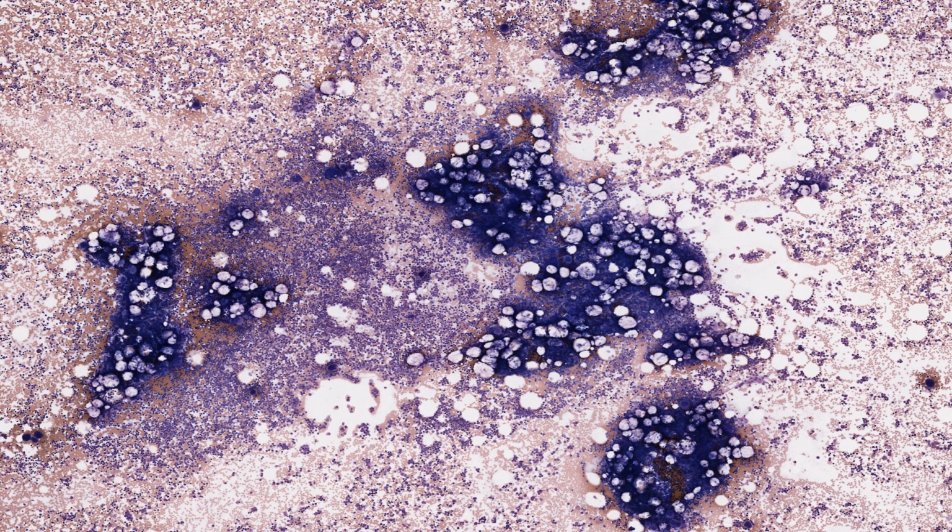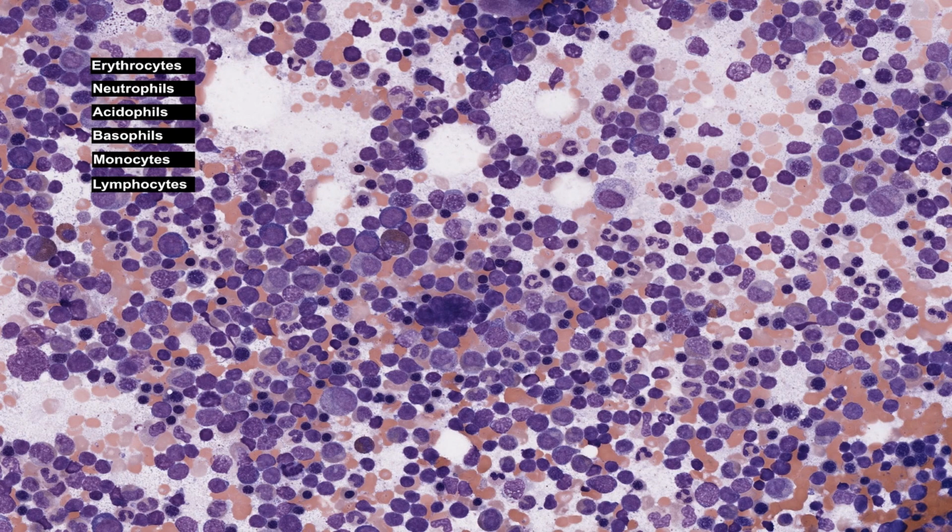The modern way to identify such cells with certainty is with immunohistochemistry, using antibodies to characteristic cell surface proteins of the individual cell types. Bone marrow is a complex tissue for two reasons. First, it contains entire developmental series of cells from primitive to fully matured forms.